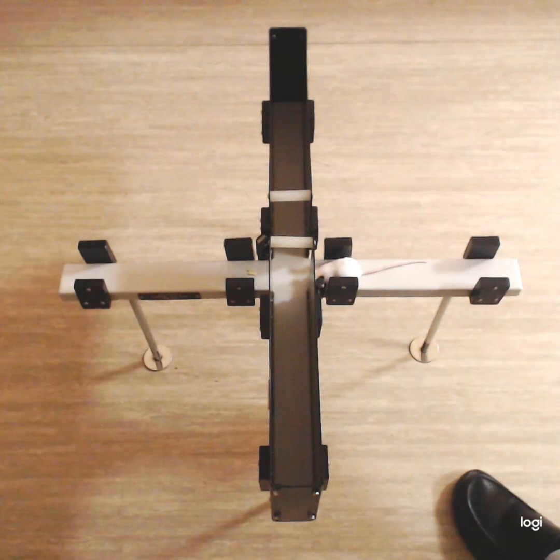See, it is showing head dips, and initially it went into one of the closed arms. So through this video recording, we can calculate how much time it has spent in closed arms and how much time it has spent in open arms in the period of 5 minutes.